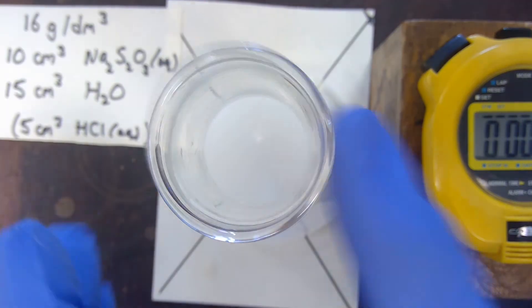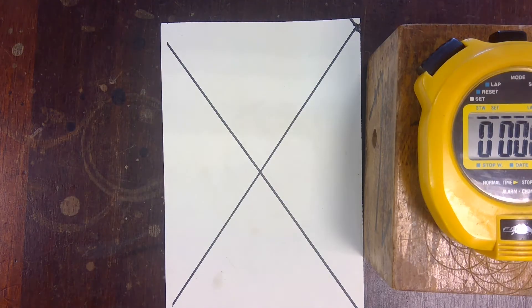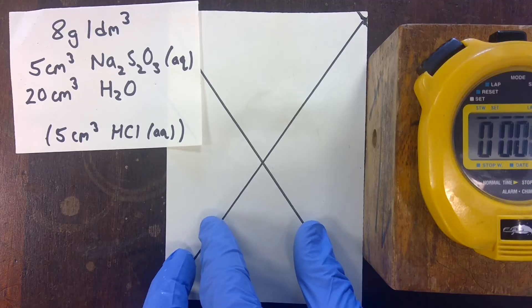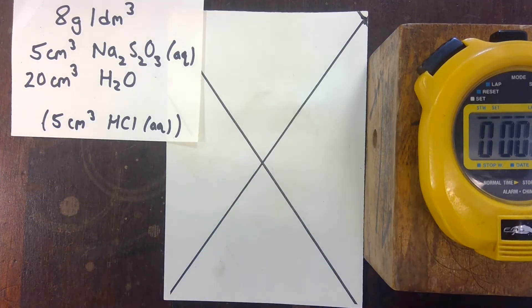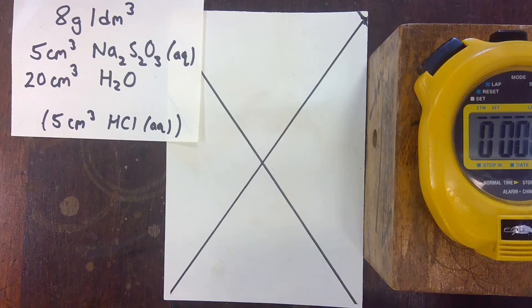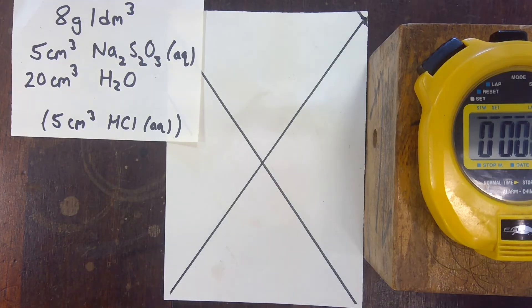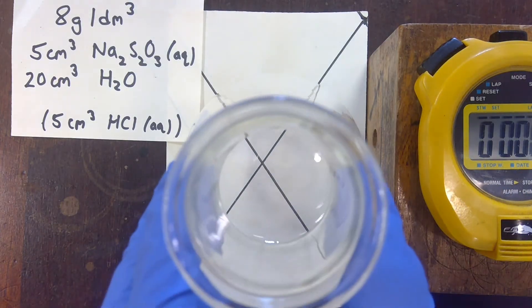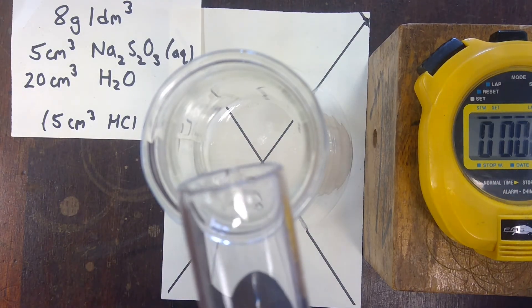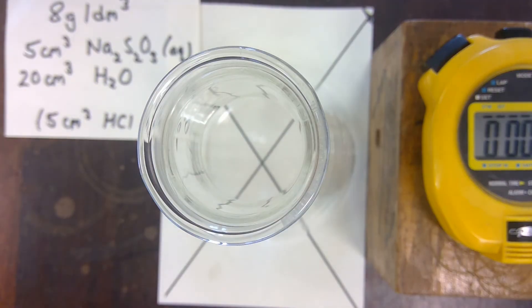The final experiment is the lowest concentration. This time we're going to dilute it down by one-fifth, which means we have only 5 cm³ of the sodium thiosulfate and 20 cm³ of water. You'll notice that in each experiment the total volume of the sodium thiosulfate solution including water is always 25 cm³, so that total volume is not an additional variable we need to account for. The concentration is down to 8 grams per cubic decimetre.